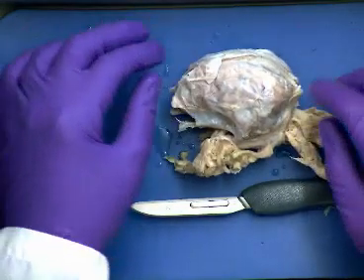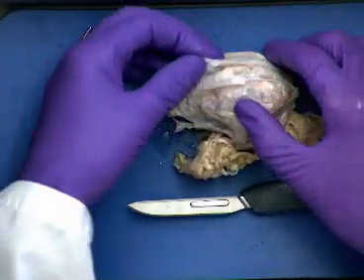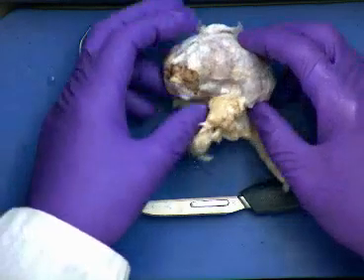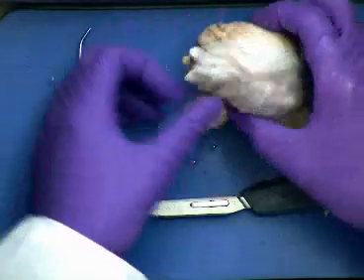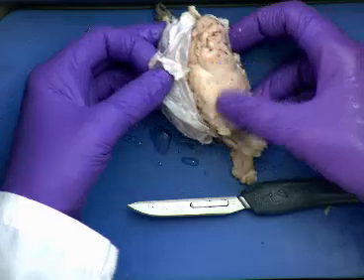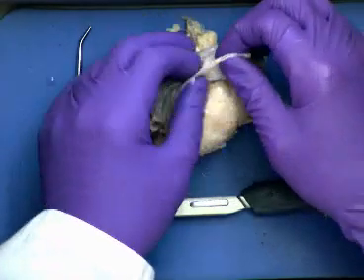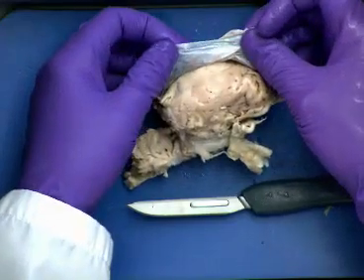And one of the things that's kind of obscuring our view of the brain is this right here. This white that we see right here is called the dura mater. Remember we saw the dura mater when we were looking at the spinal cord models? It's the durable outer meninges, if you will, the membrane that helps to protect the brain. So there's the cerebrum that we see underneath right there, and this is usually covering it and protecting it. This dura mater, we couldn't see it on our brain models, but we could see it actually on the sheep brain like that.